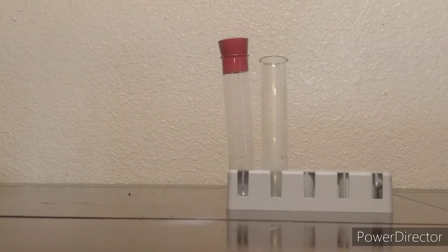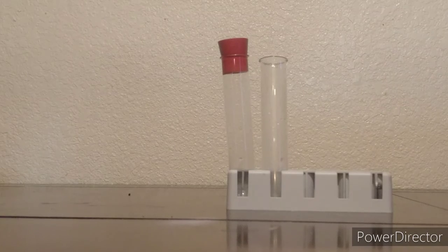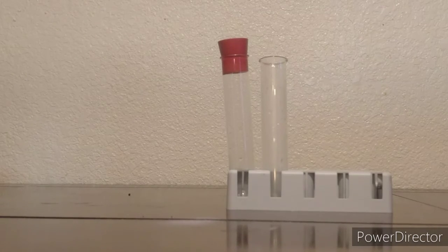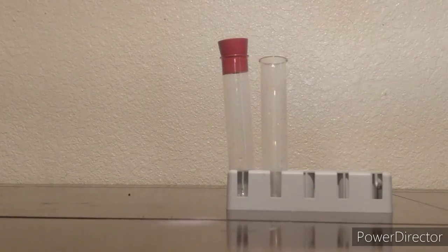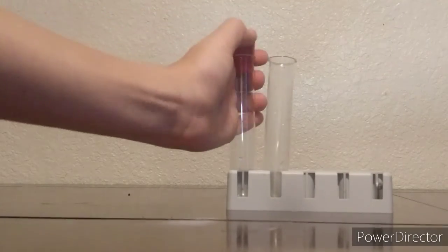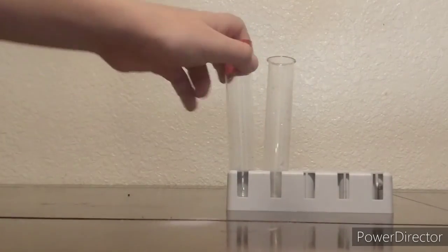Now, we did not produce pure oxygen, and I think this was because of the capture system. This isn't bad, though, because science is all about figuring something out, and we should strive to eliminate other factors. Otherwise, we would just get the same results every single time.